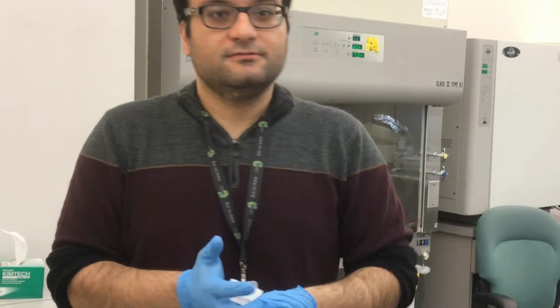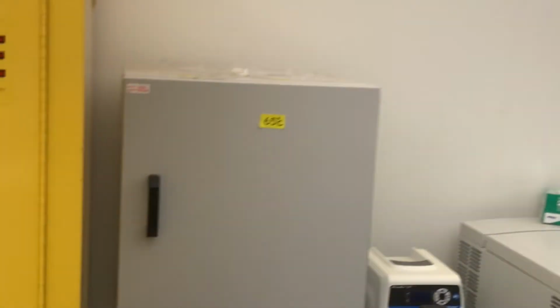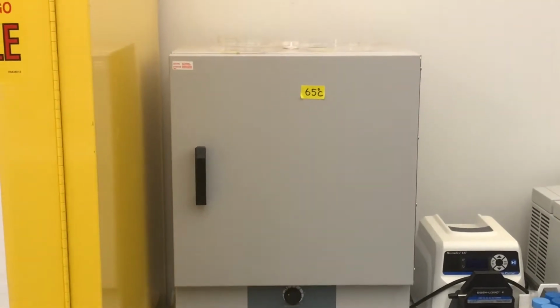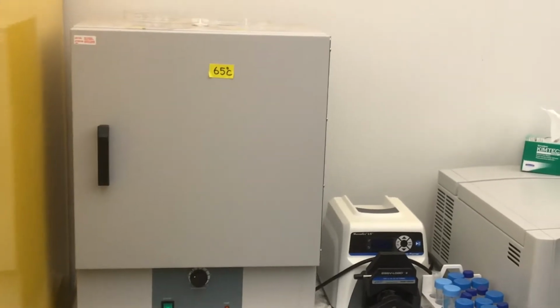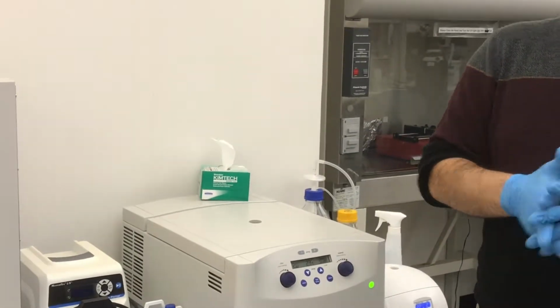Yeah, we call it curing agent. Okay. So these are heat-activated curing agents. Yes. Okay. Can you explain what curing is? Curing is the solidification. Any agent that helps a material to cross-link together, they call it a curing agent.